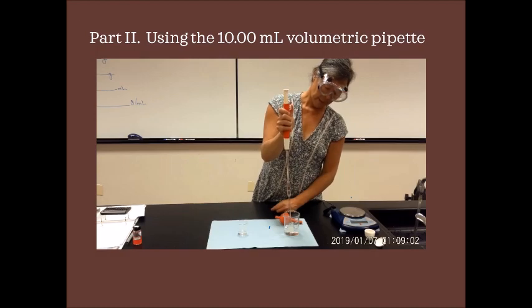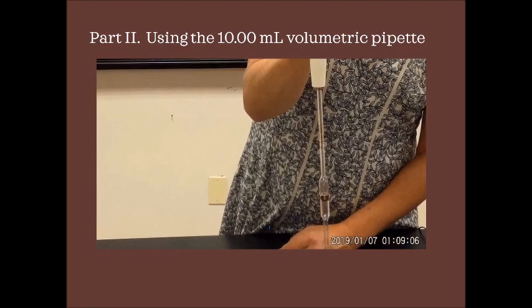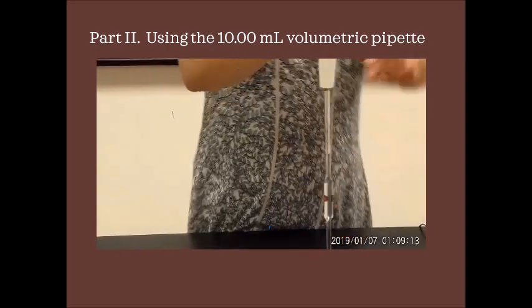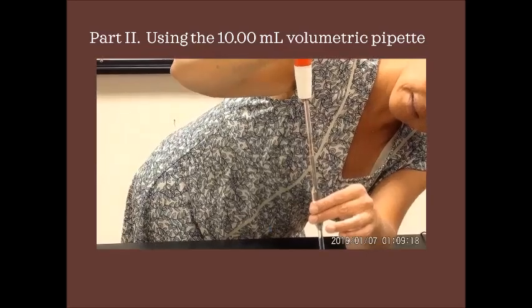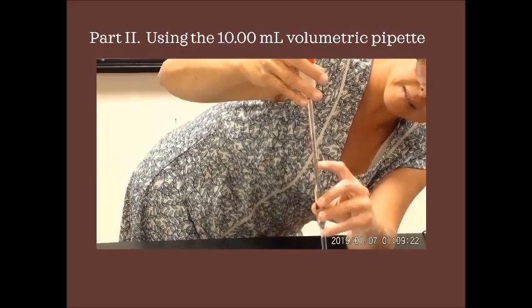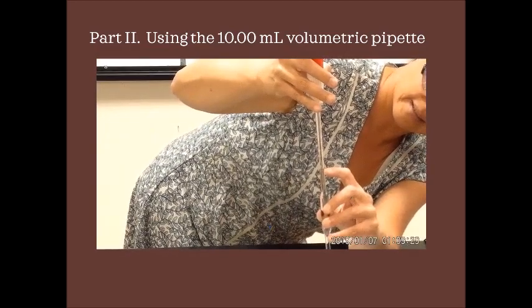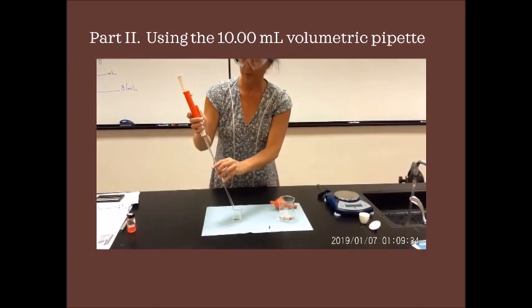Once you get it to exactly where you want your meniscus, so let me just go ahead, I waited for the meniscus to go to this line, and then again, hold on one second, there we go, right there, then we transfer it.